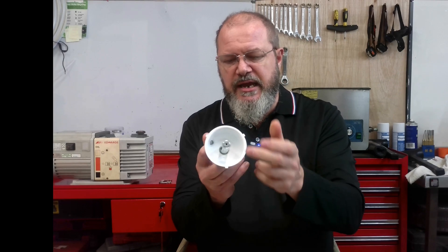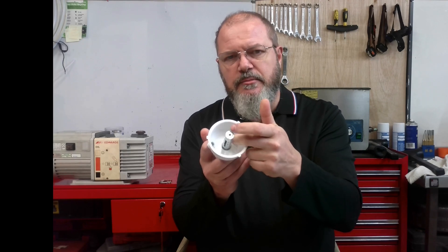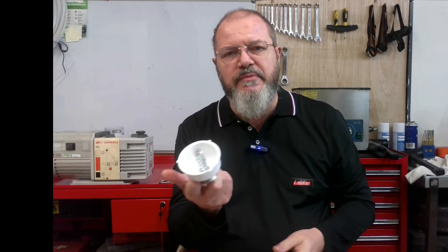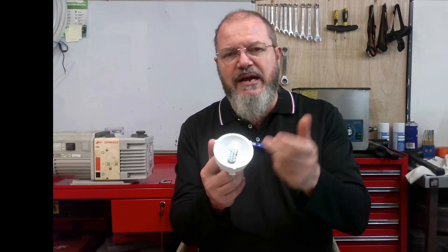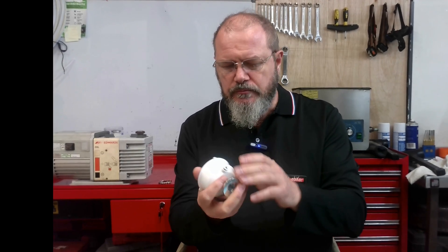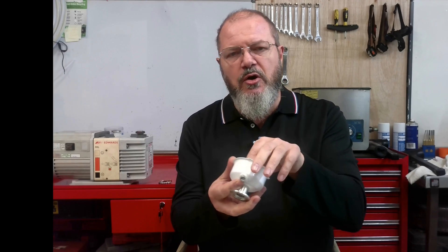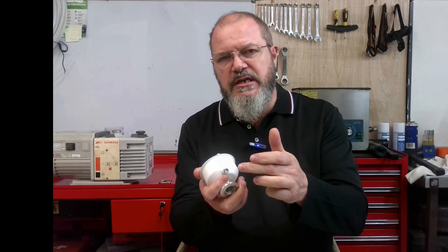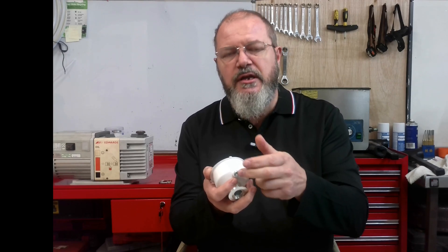Right down at the bottom, in the case of our OMF filters, the oil once it's collected in the bottom is able to drain back into the pump as soon as there's no pressure forcing against it. So when the pump is switched off, or when it reaches full vacuum and sits there for a period of time, any trapped oil will flow back into the pump. You also have a drain plug on the side — if your pump is in use all the time at relatively high pressures, oil will collect, so the drain port allows you to drain that out. It also gives you the opportunity to fit an oil return so that even when the pump is in full operation, the oil can still return — normally through a gas ballast port — back into the pump.